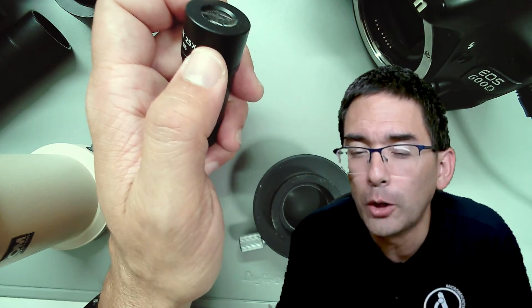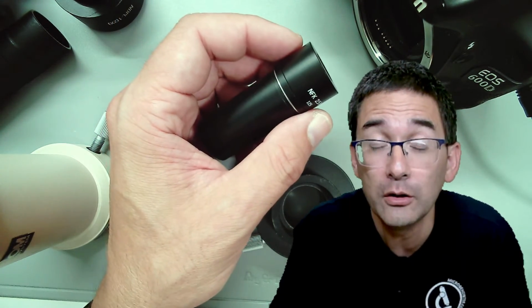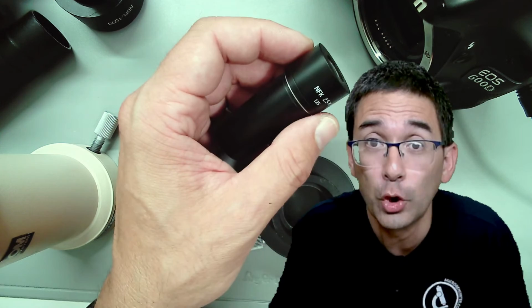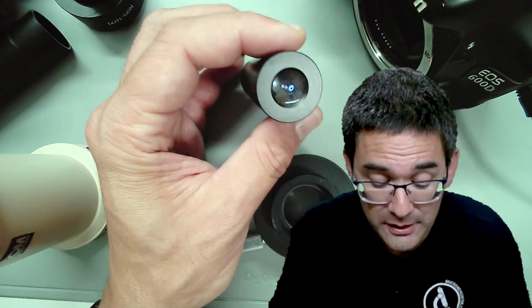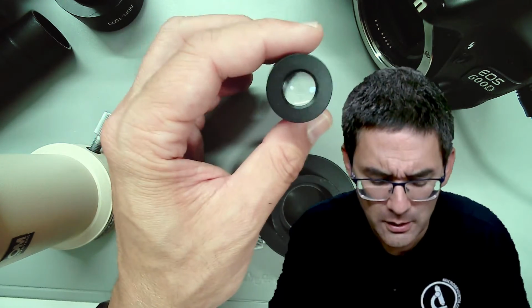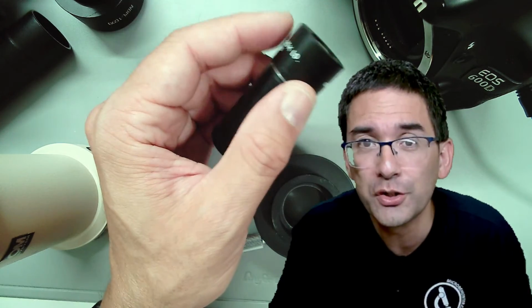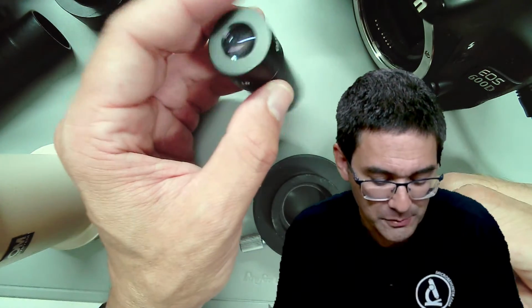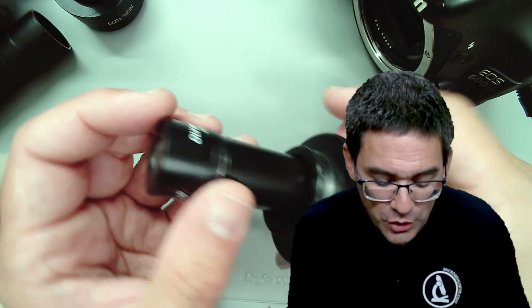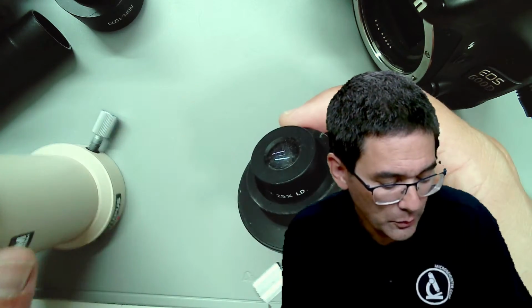I use Photoshop to counter the aberrations. Yes, that's also something that I have done. There are certain techniques in Photoshop to remove the purple and yellow fringing. So that's possible. I think there are even filters that you can use, because this chromatic aberration is not specific to microscopes, but also occurs in other optical systems. This essentially should illustrate to you that companies try to deal with this issue.